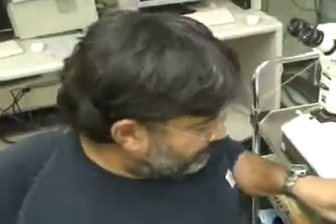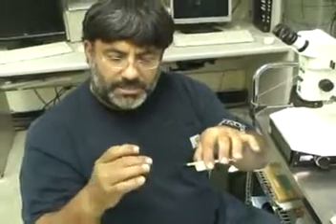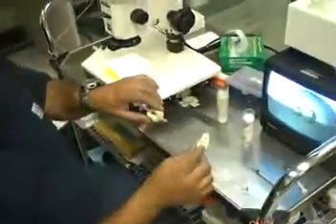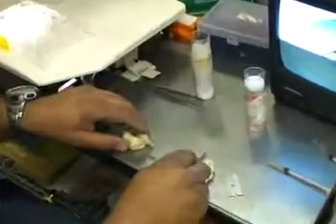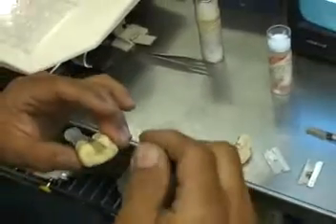For the second part, I'm going to show you how to cut the top of the capillary, which is actually sealed when it is extruded. I take a piece of clay again and put it right there — that will ensure that the piece of glass is saved in there. Now we have the capillary which is flat and cut.